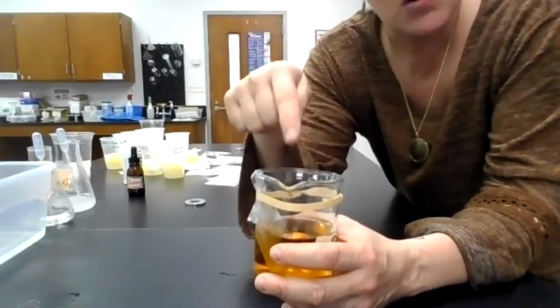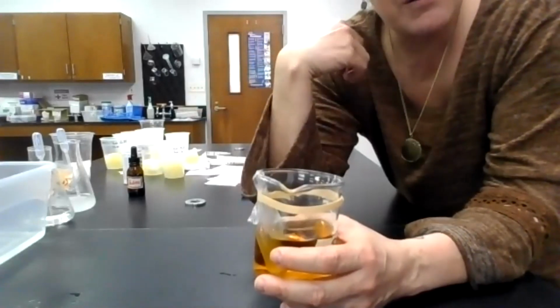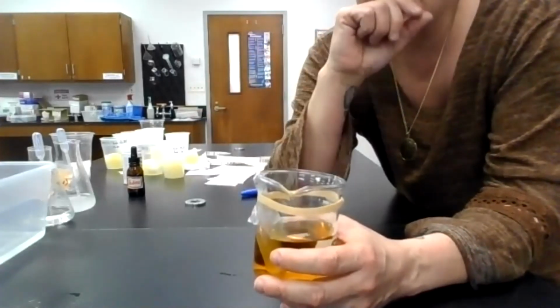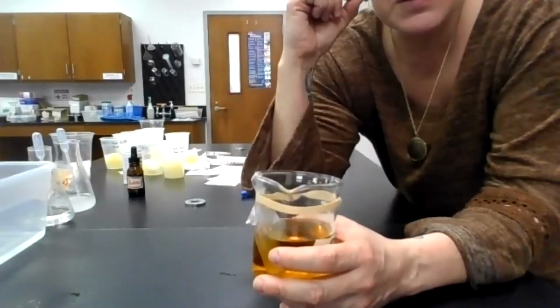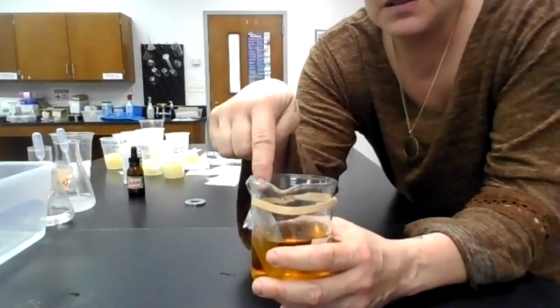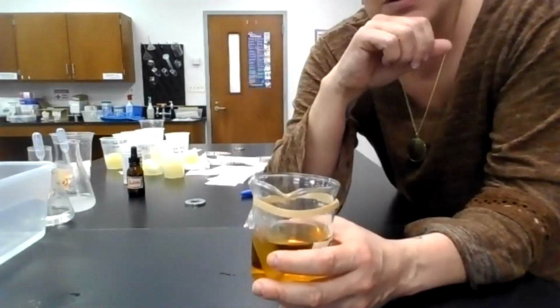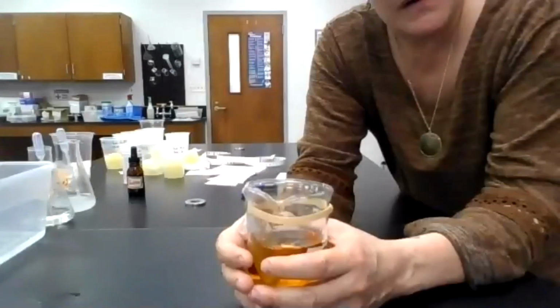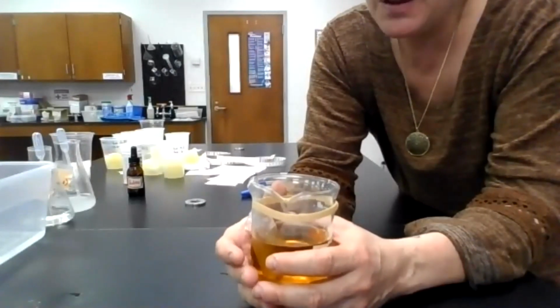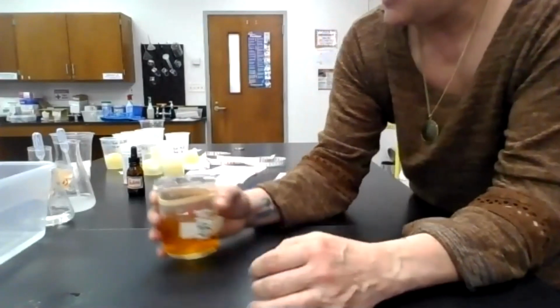Right now in that beaker water, there is no starch, there is no glucose, there's nothing but water and iodine. So we expect that if something can leave the bag through those small pores, it will diffuse from high concentration inside the bag to outside the bag into the water. Now, I told you that glucose is small. There's a chance, yes, that glucose will leave. Starch, being a big molecule, probably will not escape the bag to get into the beaker water. Okay.